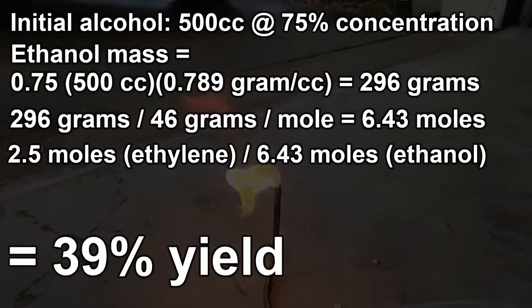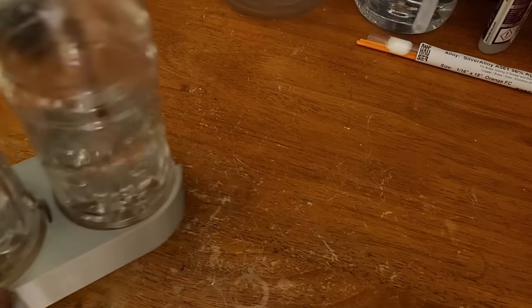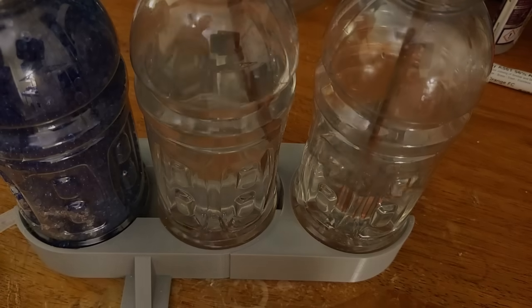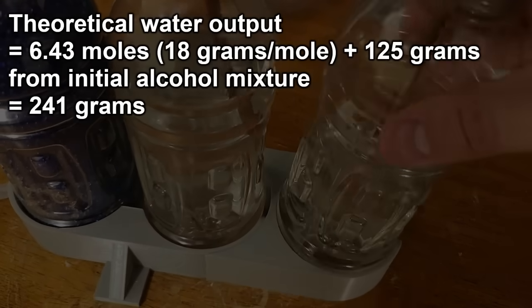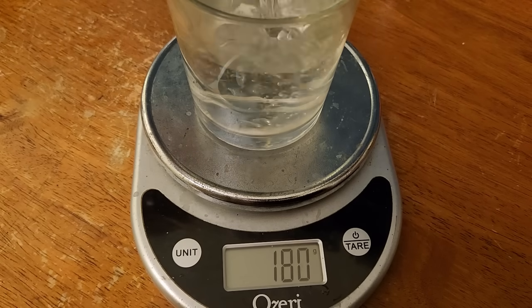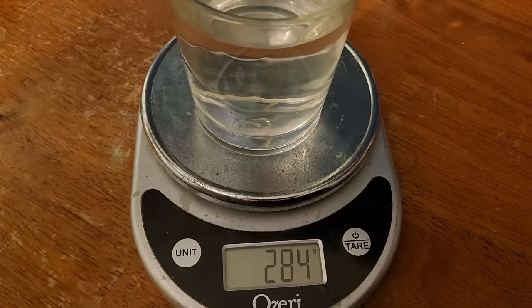I started with 500 cc's of Everclear at 75% concentration by volume, which should mean I had 296 grams of ethanol or 6.43 moles. This means I only got a 39% yield from this process. Not exactly amazing, but it's still cheaper than paying over a hundred dollars an ounce and requiring a refrigerant handling license. I think the answer to our missing yield can be found in the liquid that came over from the reaction. Working out the math, there should be no more than 241 grams of water in the mystery liquid, but the scale gives us 284. This liquid also has that nasty solvent smell, so I think there's some ether in it in addition to the water.